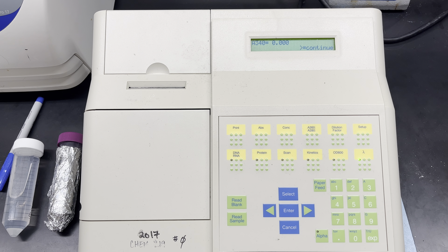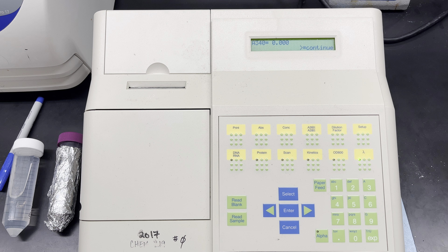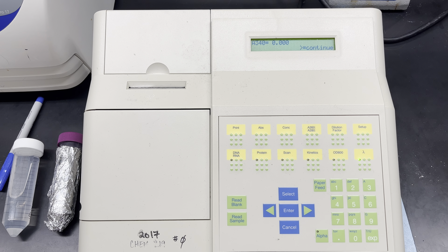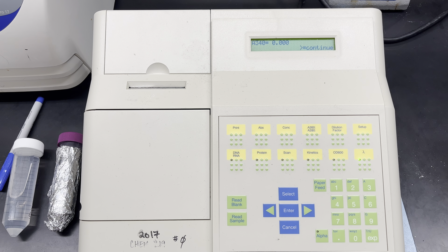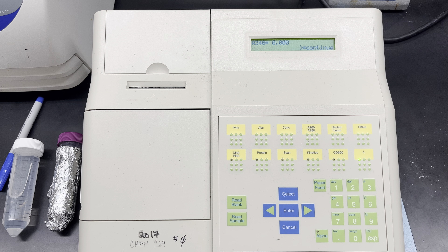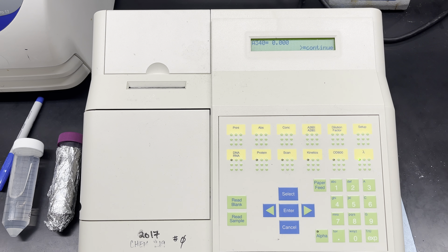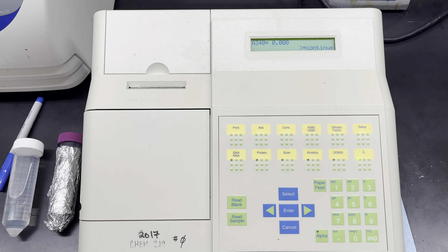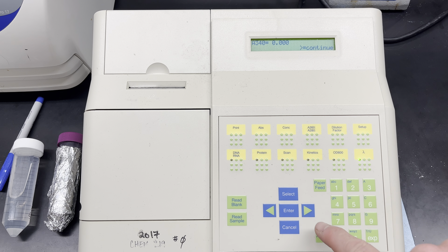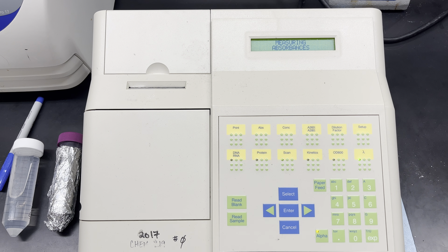Now I'm going to take my P200 pipet and add 50 microliters of my enzyme sample. I'll add that, pipet to mix it very quickly, and maybe agitate it like this to mix that solution quickly. Then I'm going to press the arrow to continue and press 'read sample.'